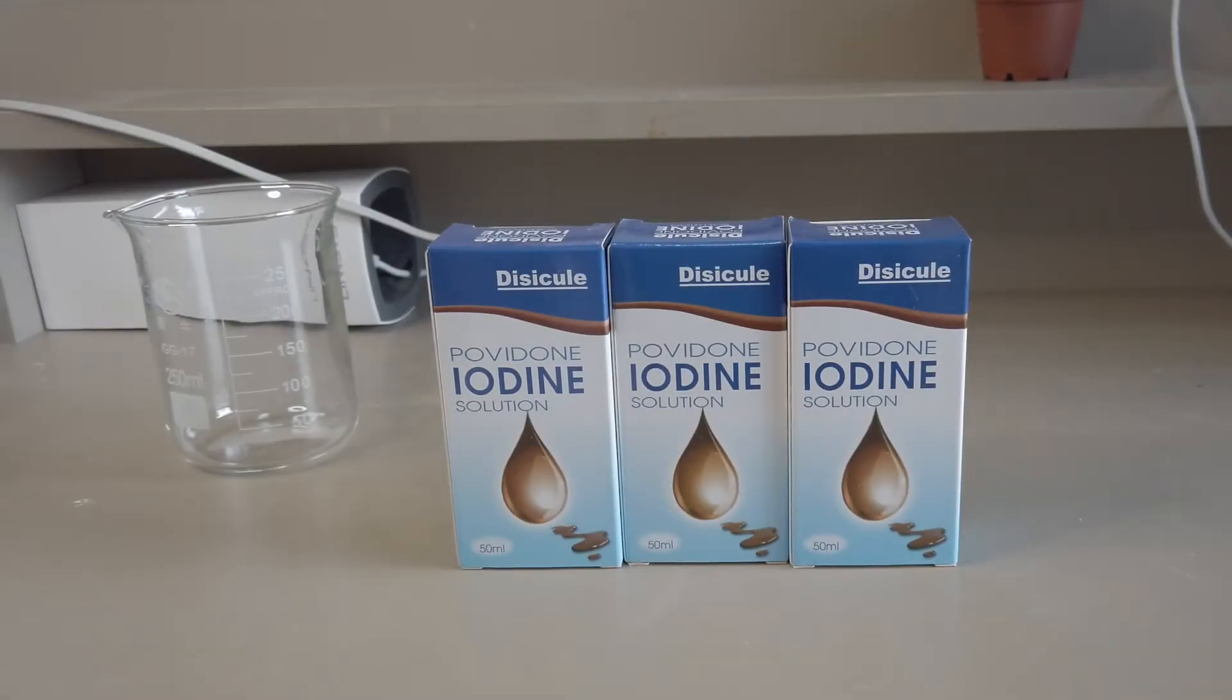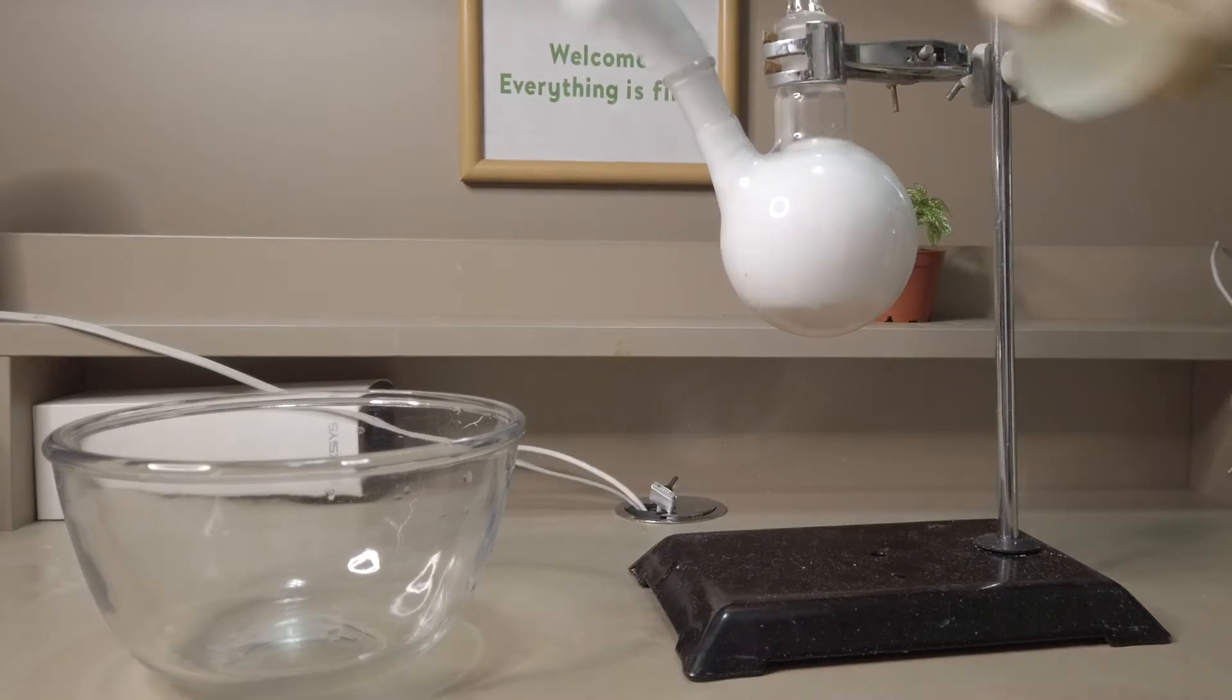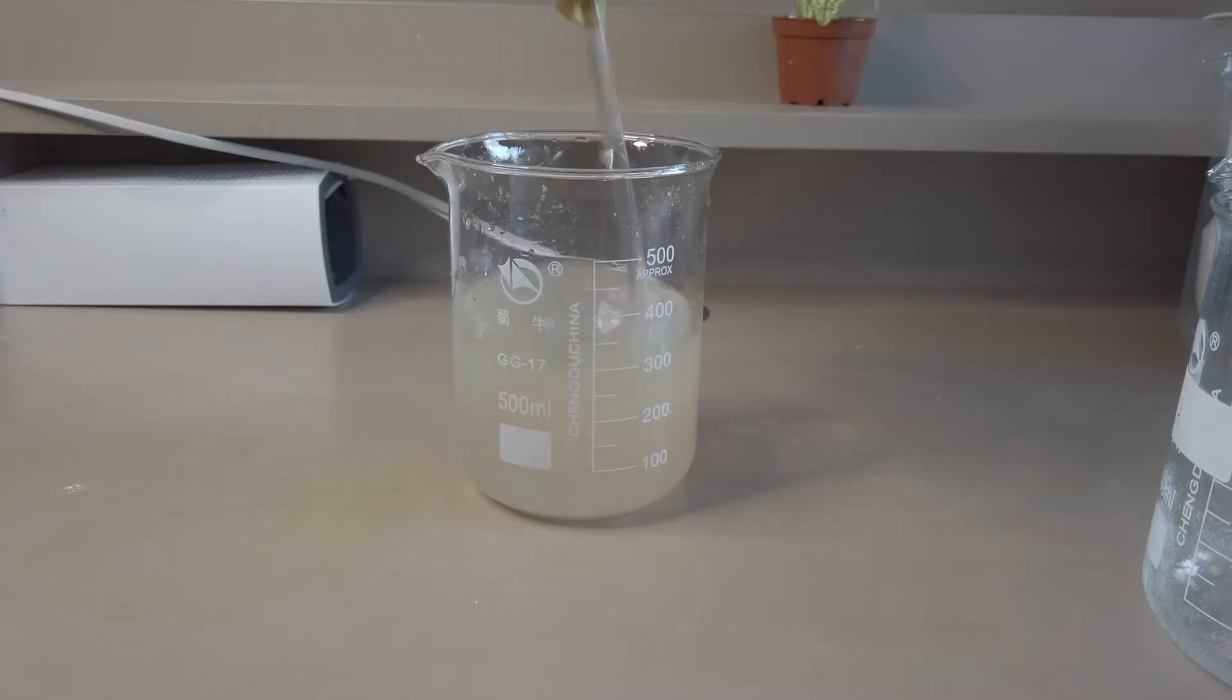Povidone iodine is a widely used disinfectant. It contains the element iodine which has a lot of unique properties. Today we decided to mess with the povidone iodine in a few different ways.